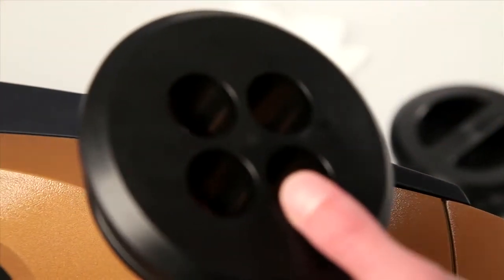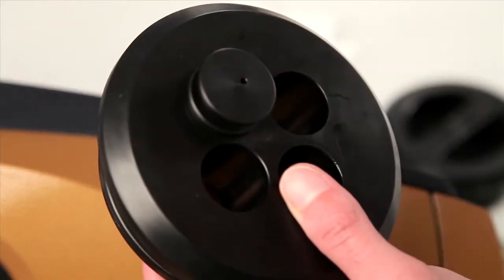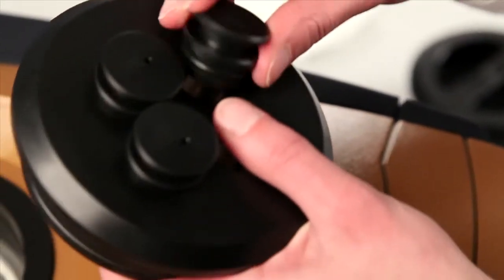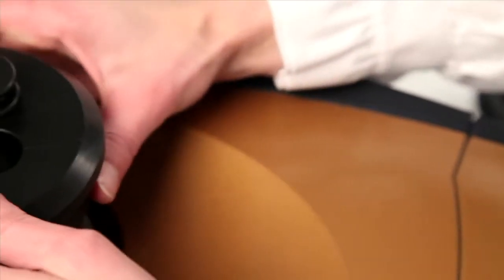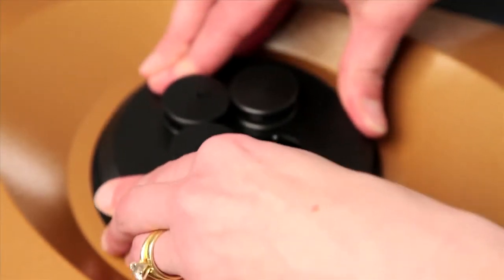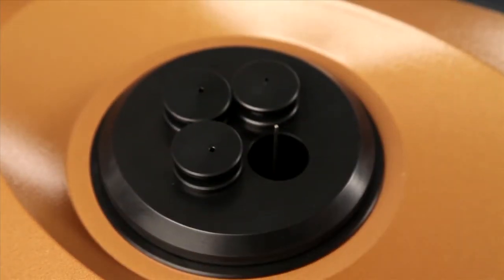From here, the lid can be added. This is done by pressing these closures in place for those that aren't occupied by the batch. Now the entire lid is placed on top of the instrument, and pushed down for a good O-ring seal.